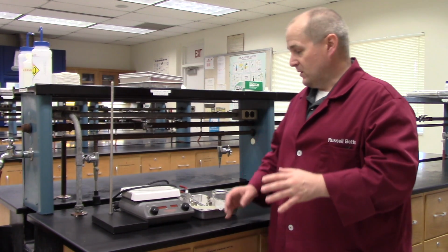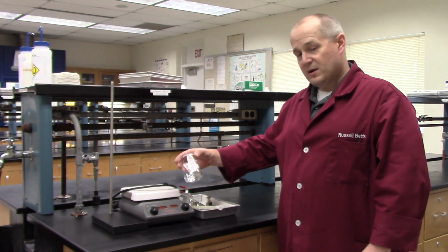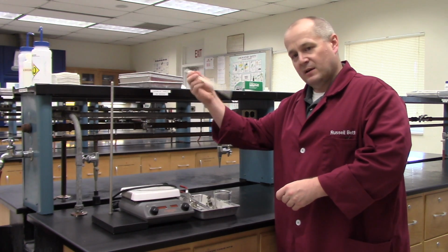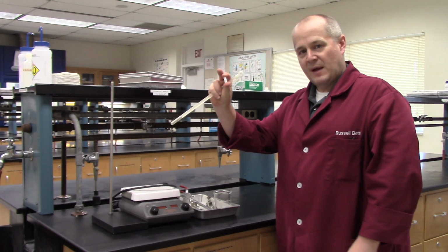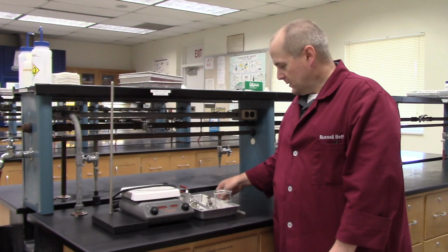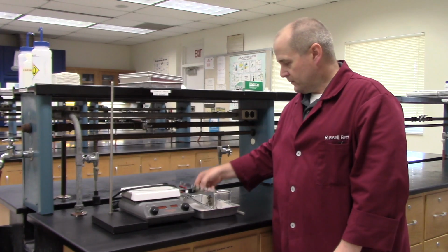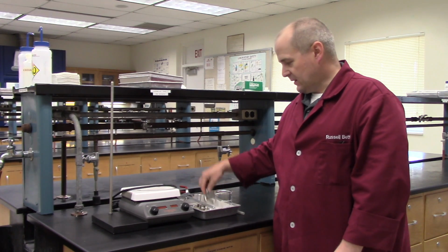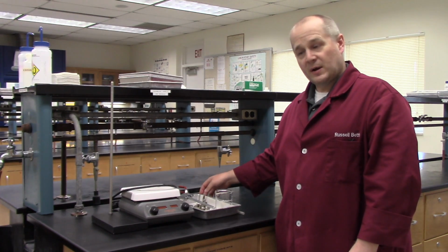Now, to start with, you need a clamp stand. You're going to need a hot plate. These are found in your bench and one of your top drawers. You need a 250 milliliter beaker. You need a stirring bar remover, which is just a magnet inside of a piece of plastic. You need a stirring bar, which is just a small magnet wrapped in Teflon. You will need a thermometer clamp. These are found in your bench in the very bottom drawer. You'll need a 3-prong clamp, and you'll need a clamp holder. The clamp and the clamp holder are found in your bench when you come to lab.